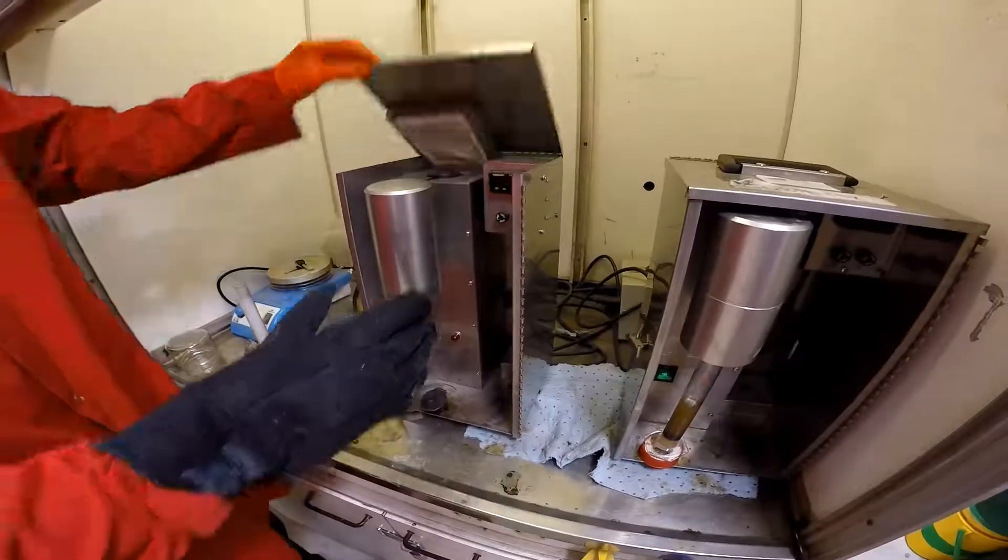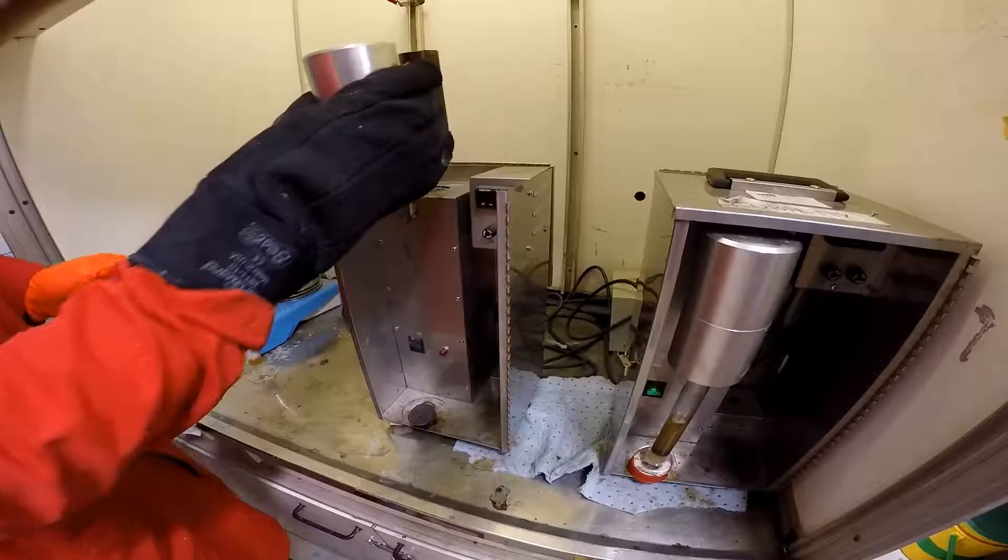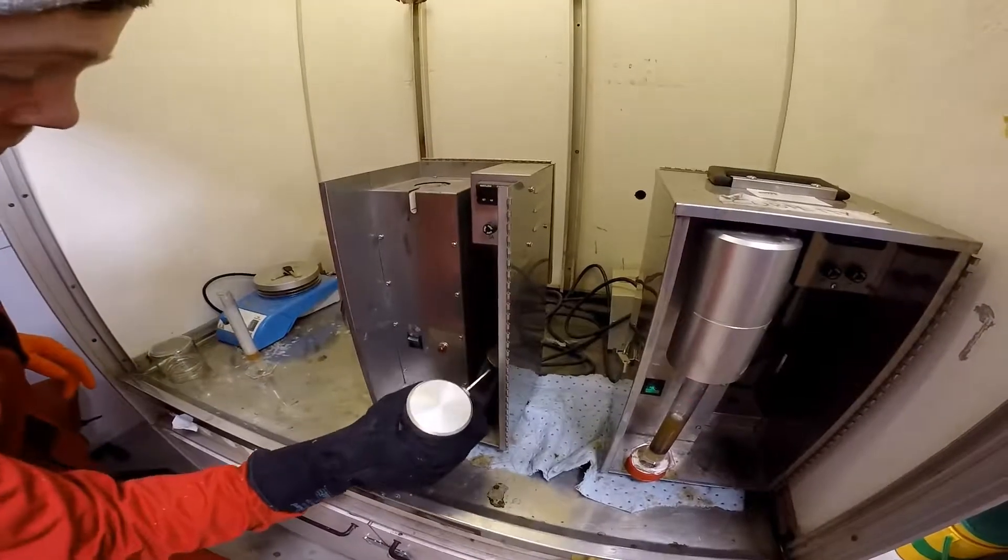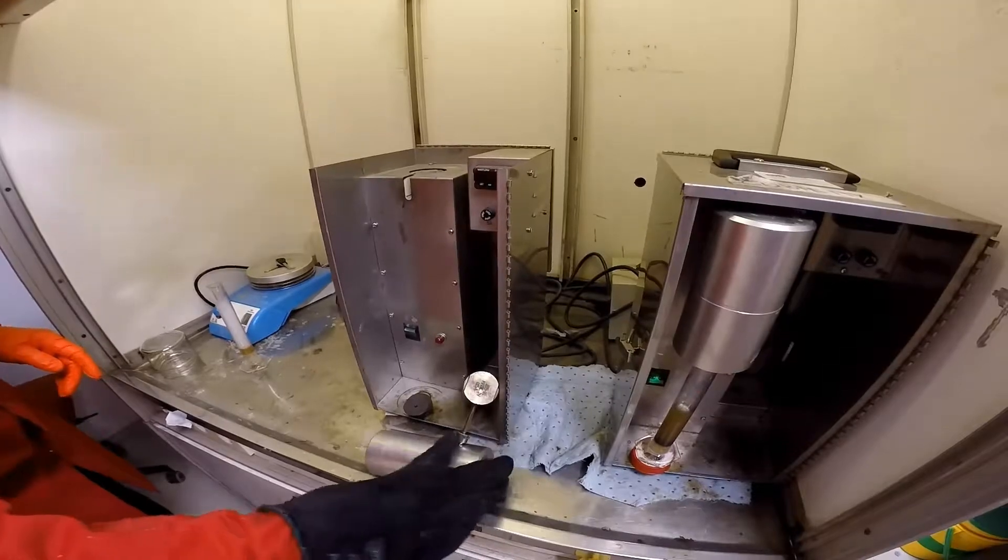Okay, now remove the retort from the heater. Just be careful, it is very hot, so wear some protective gloves and let it cool.